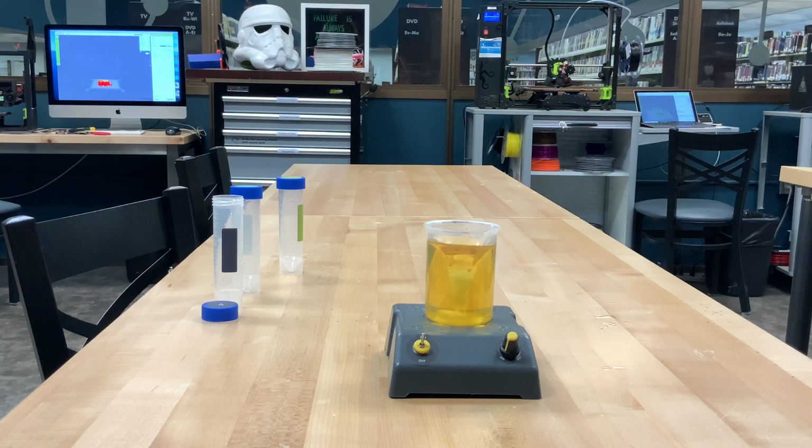And that's why this kind of chemical reaction is called an iodine clock, because the chemical reactions tell us how long it has taken for one of the ingredients to be all used up and for the next set of chemical ingredients to start their chemical reactions. Here we go. And that is our iodine clock experiment.